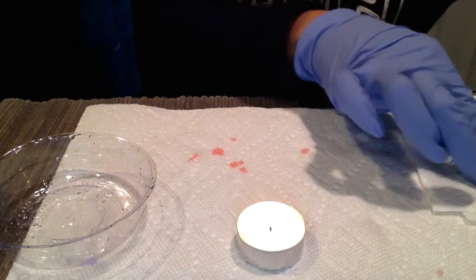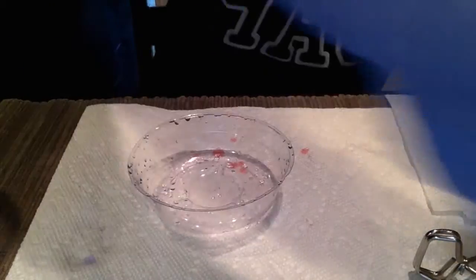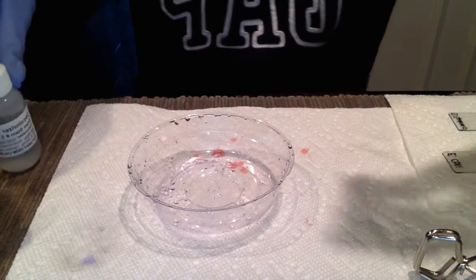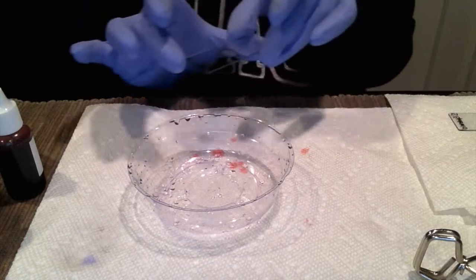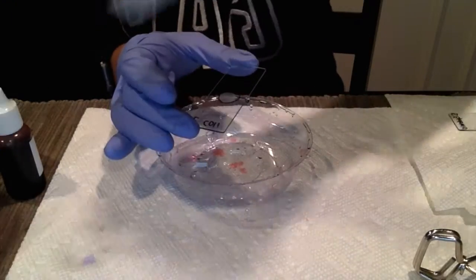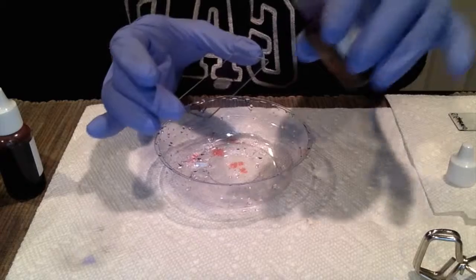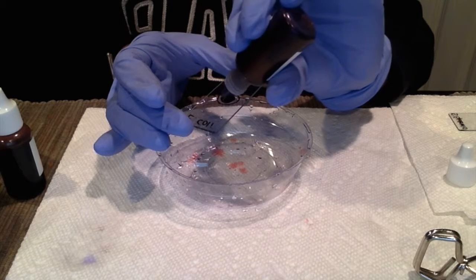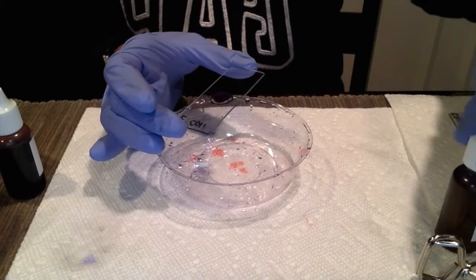Now I'm going to let that cool. I've got my tray here and also my crystal violet, iodine, decolorizer, and safranin. I'm going to place the slide over the tray and with crystal violet — Gram stain number one — I'm going to put one to two drops on the front face: there's one, there's two. I move it around without touching the glass. I'm going to wait 60 seconds to let that sink in.